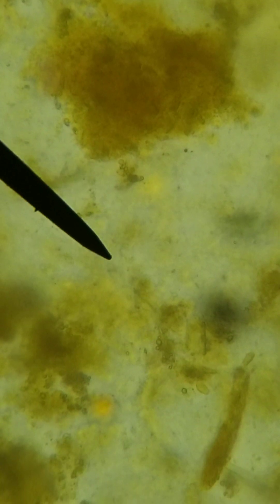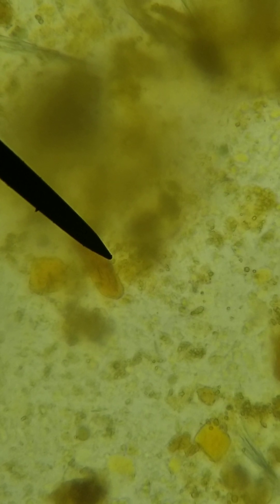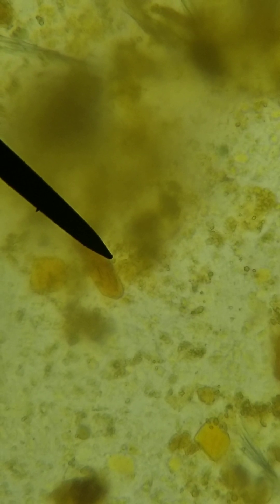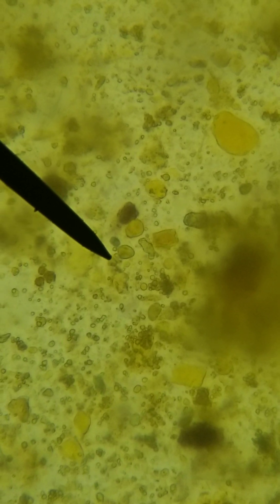Just to let you know, these are not very large. With the magnification of my phone and the microscope you can see how small they really are. The cysts are about the size of a white blood cell, so if you see some cells that look like a white blood cell it might be them — they are kind of ovoid, kind of like that one right there.